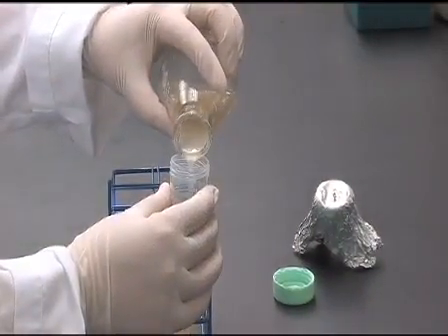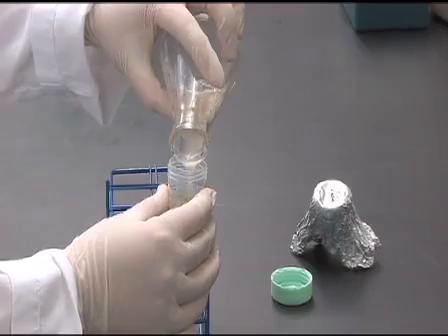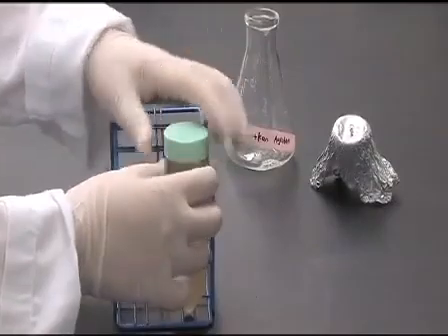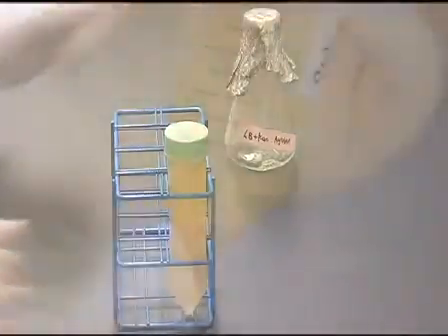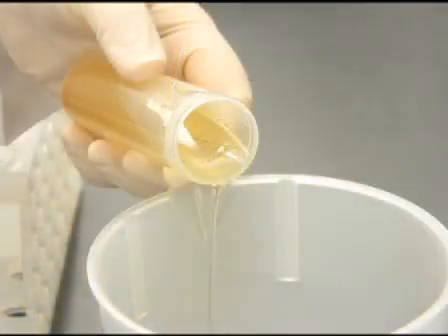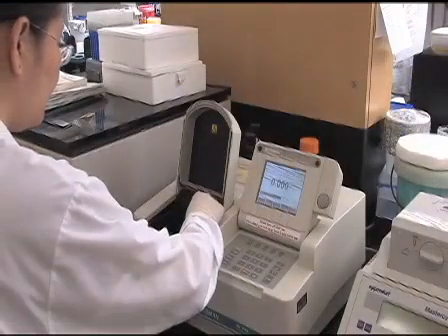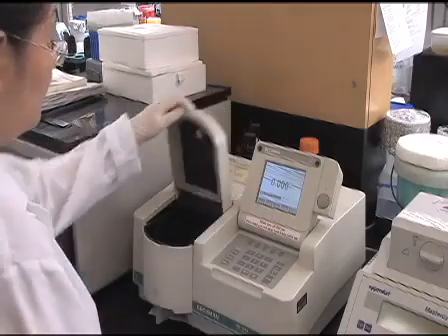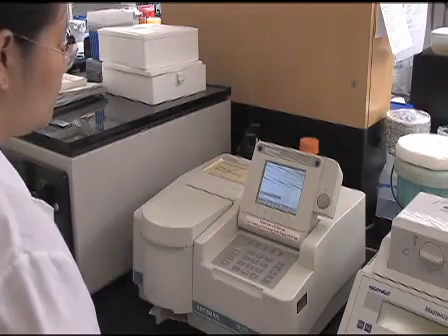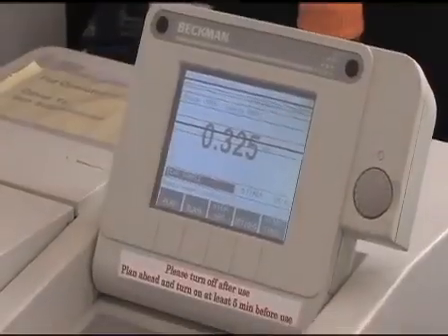After the growth period, collect the cells by placing the culture solution in a 50 milliliter centrifuge tube. Run it in the centrifuge at 5000 g for 30 minutes. Resuspend the pellet with nitrogen-free nutrient solution. Make sure to dilute the Agrobacterium cells to 0.3 at OD 600. This concentration is important for maximum transformation.